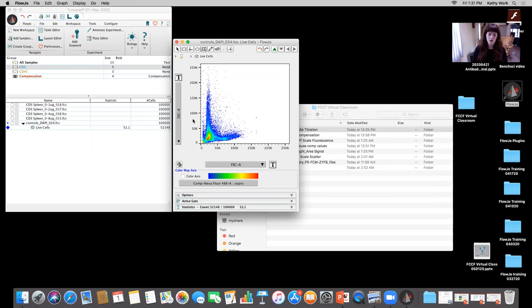Because when we're trying to pull out debris from cells, it's going to be sometimes very difficult by scatter. And the inclusion of some of these vital markers will help us dramatically in pulling out our populations.